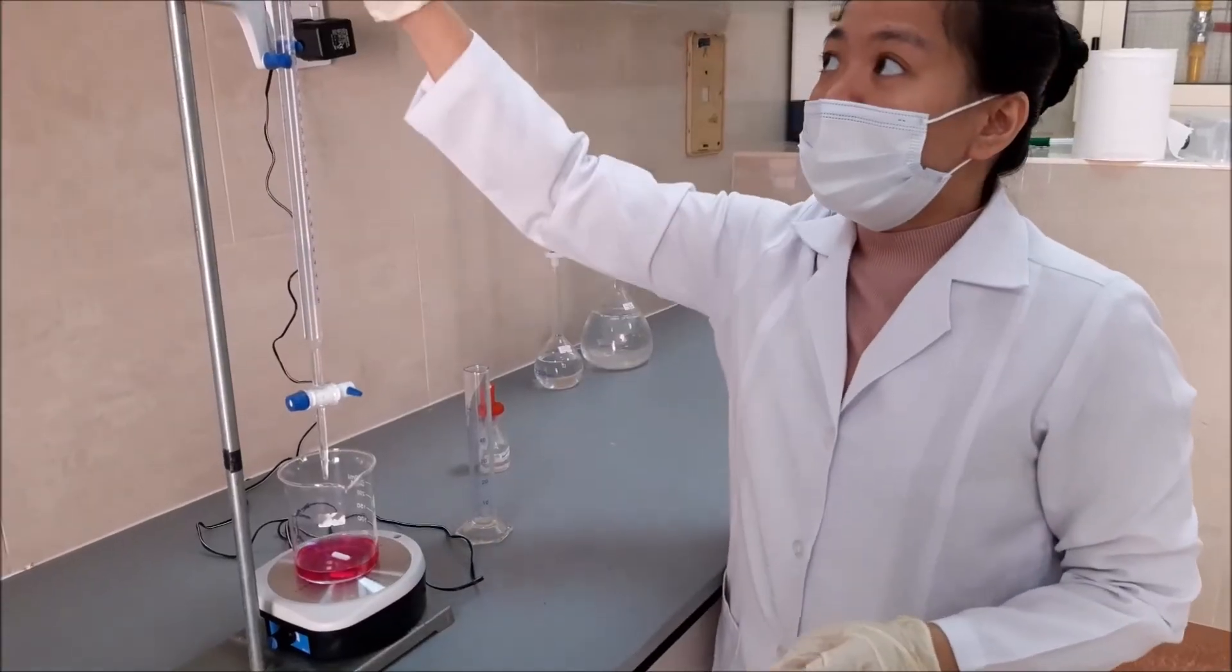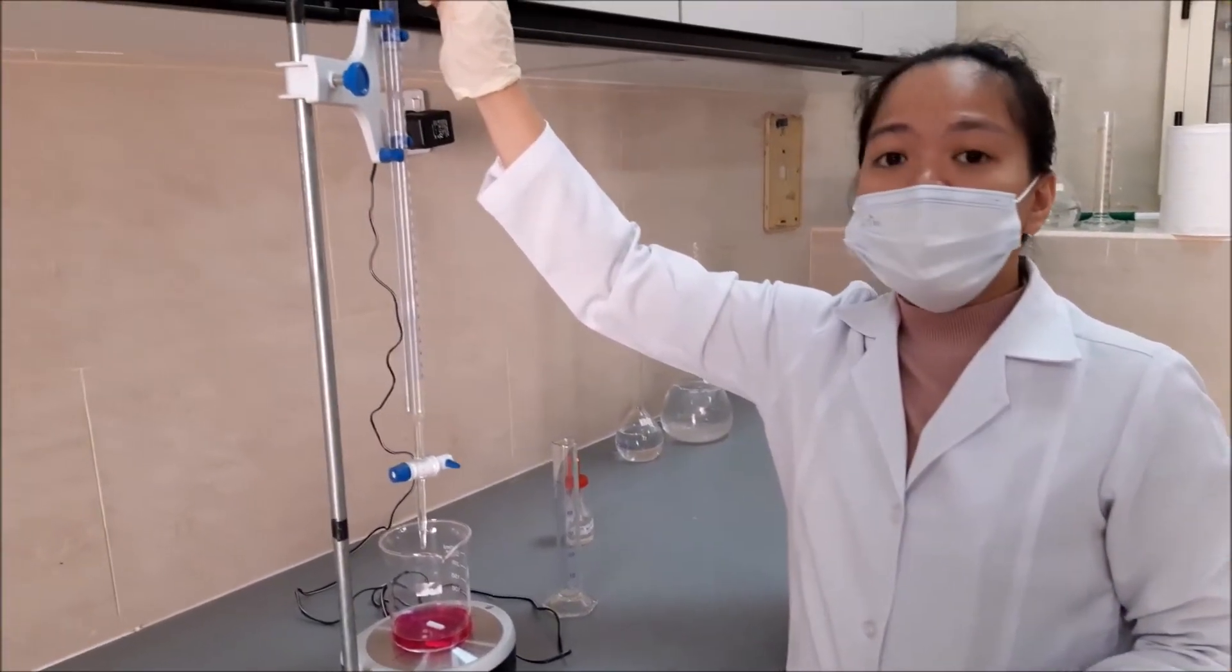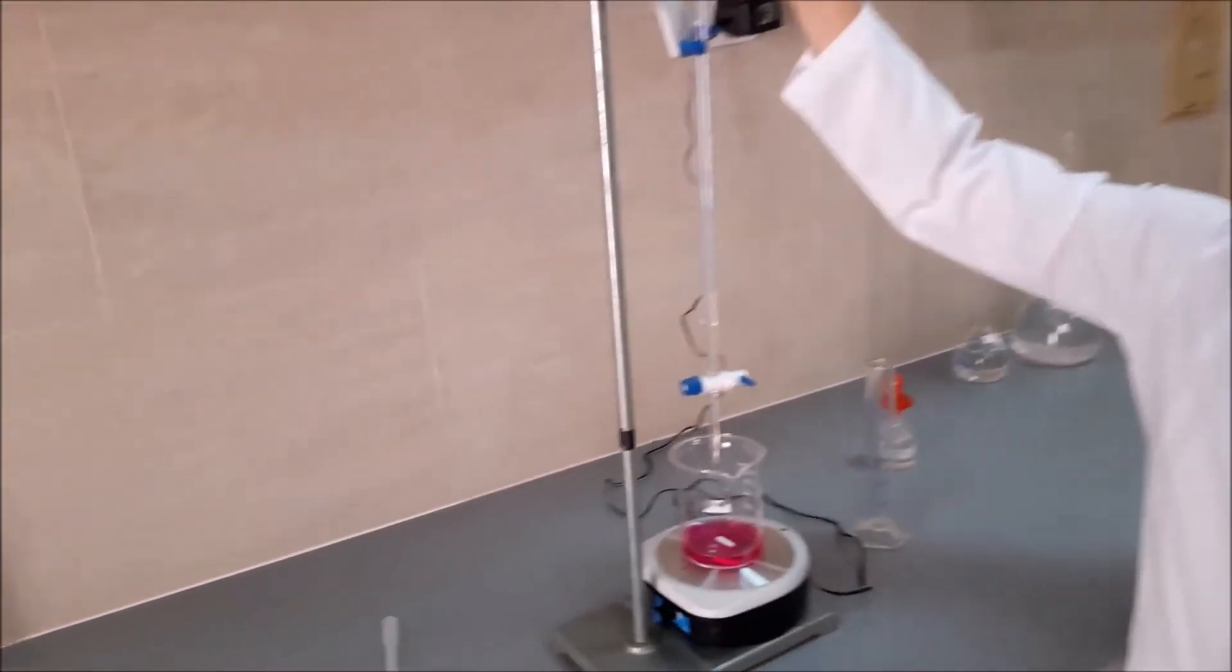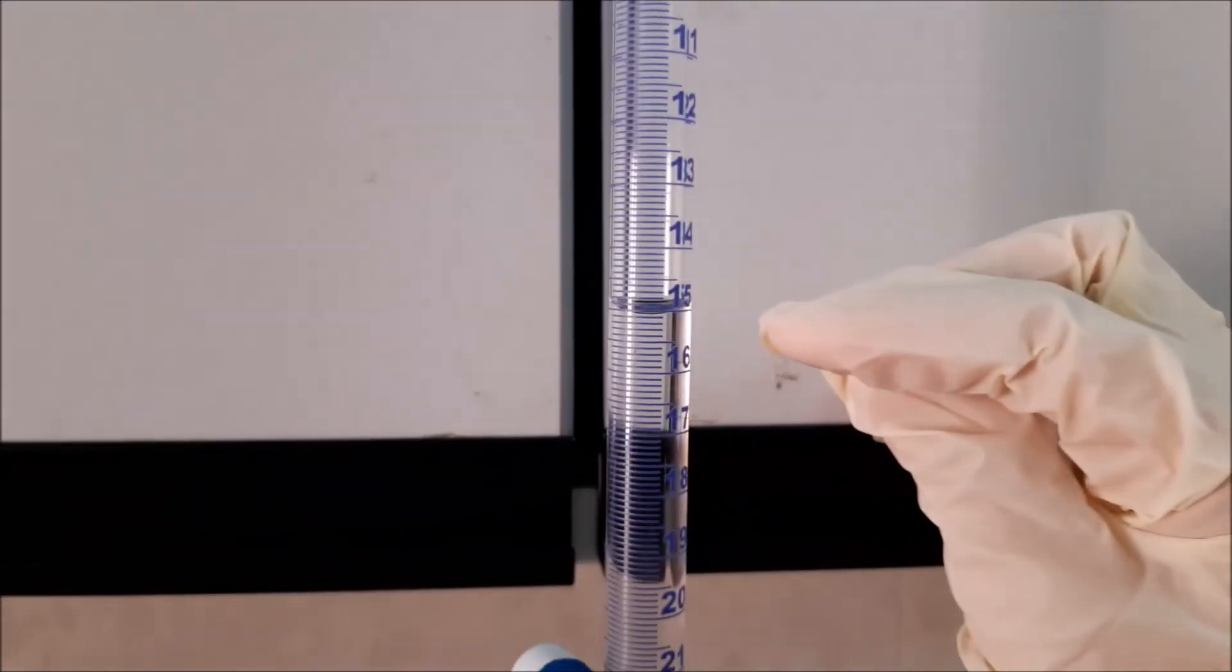Next time, the liquid from the burette starts from 15. So the initial level is 15. We will consider this as our zero.